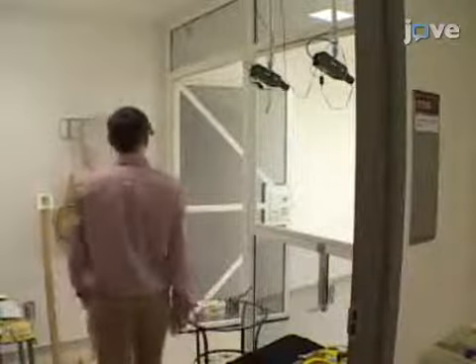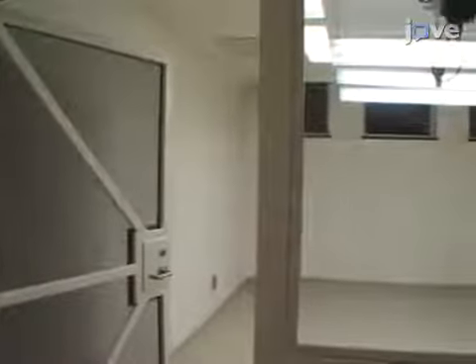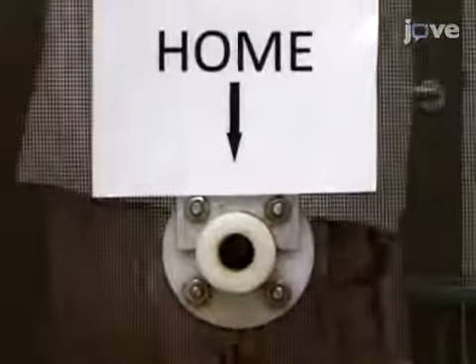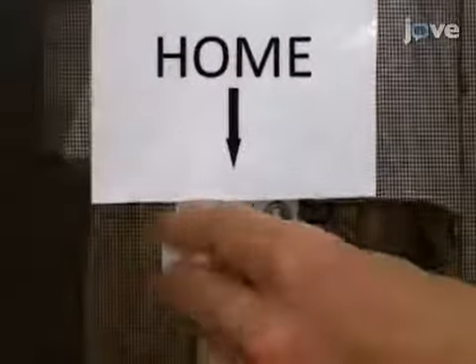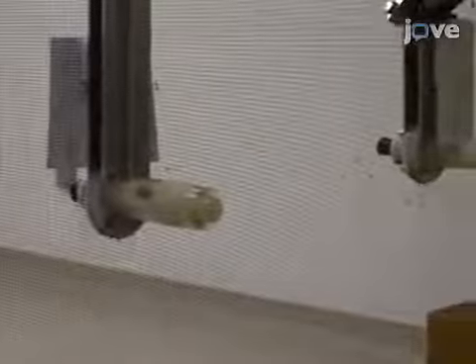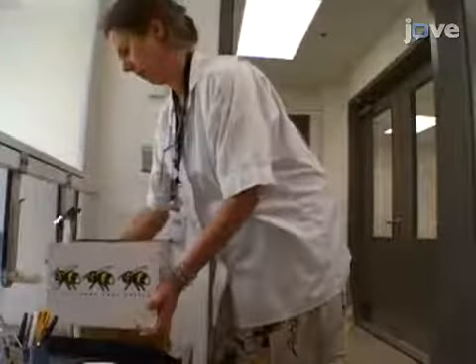The testing environment for this protocol must be an isolated room or a 2 cubic meter metal screen flight cage. On the flight cage, a small hole with the diameter of a nickel, or about 2 centimeters, serves as the entry and exit point for the bees. Bee colonies are connected to the test space using a conduit that is wide enough to let several bees circulate simultaneously.